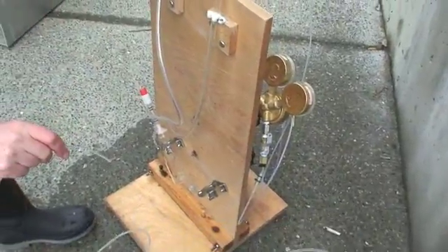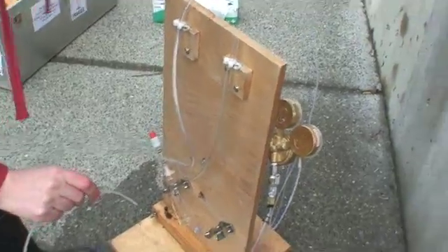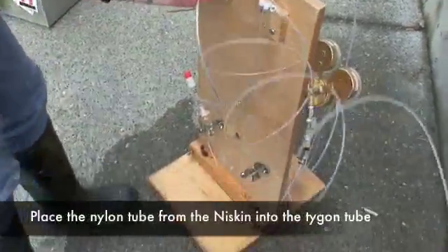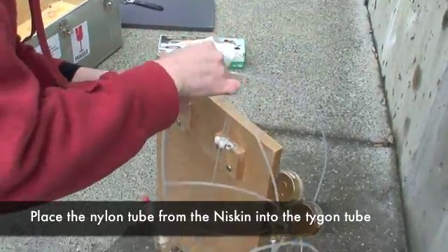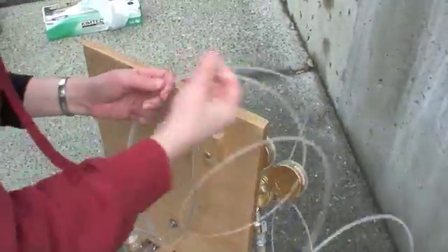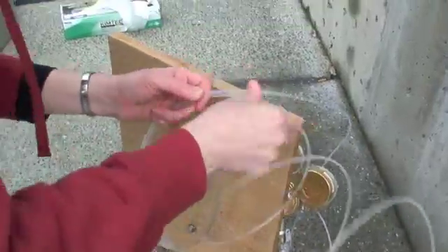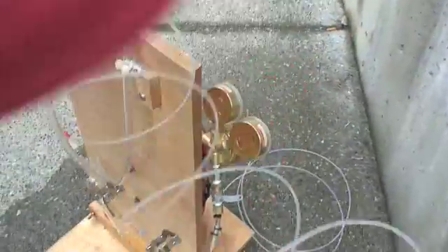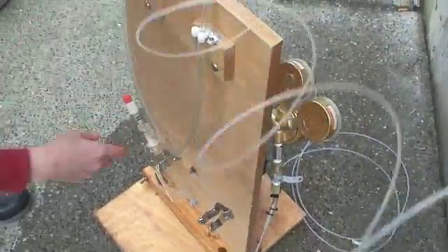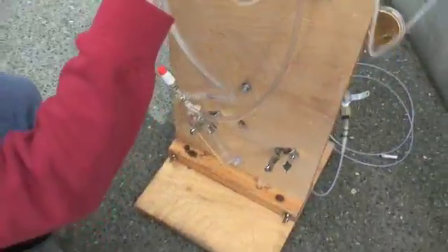Maybe it's been 10 seconds. Wait a couple more seconds, it's okay. I can hear the CO2 bubbling, that tells me it's still on. That's good. A little windy here in Victoria today.